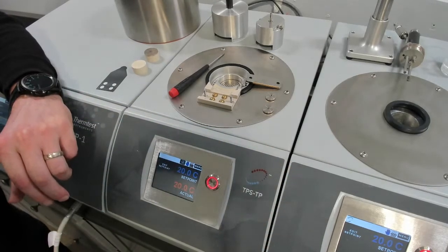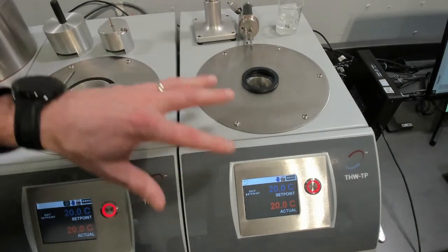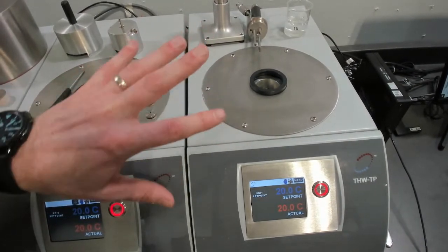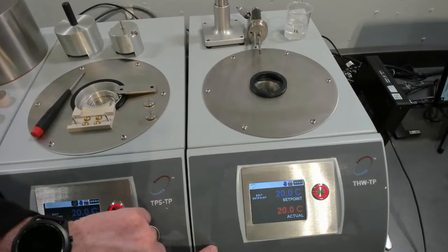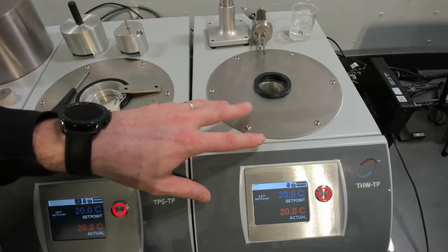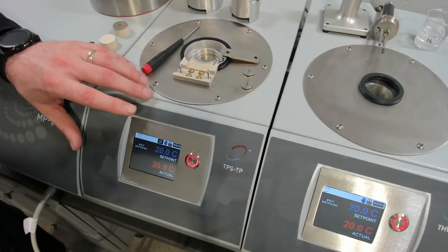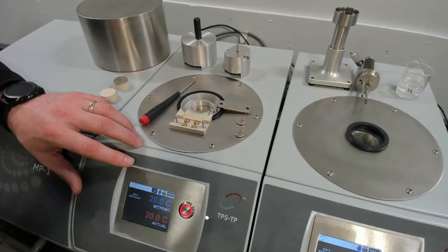And on the THW, the basic temperature range of what you see here is 10 degrees to 200 Celsius, but it can be expanded with similar types of cooling and heating methods to go all the way from minus 160 Celsius up to 300 Celsius. So the basic one is 10 degrees to 200 for the transient hot wire, and the basic transient plane source temperature platform is 0 to 300. So let's set up a sensor first.